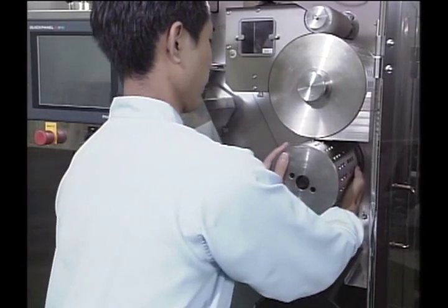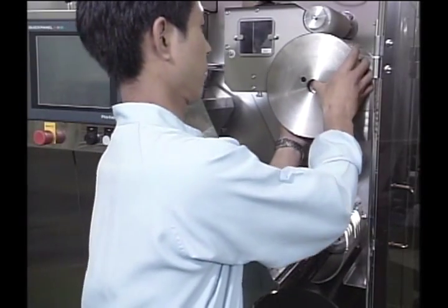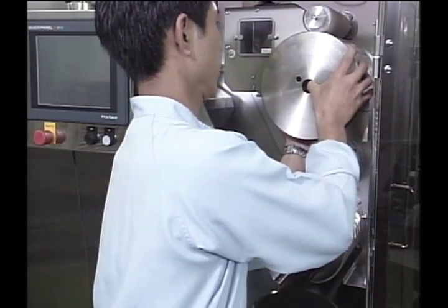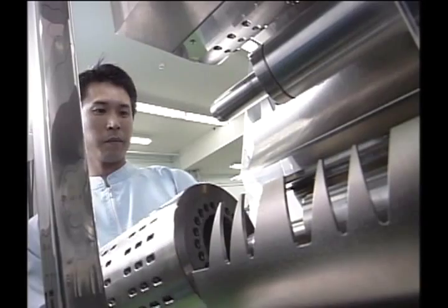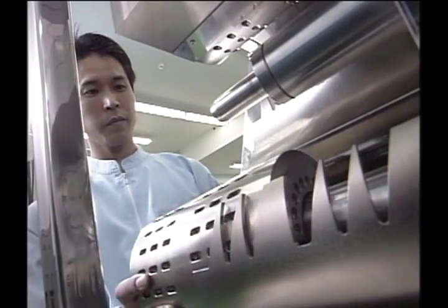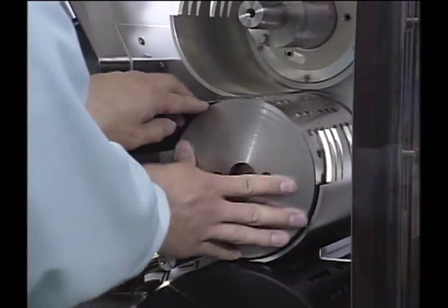The unit that controls the rectification or transportation can be detached without doing anything to the light or camera that have the main role in the inspection. It is also superior for cleaning validation, and the assembly status can be determined by just pressing one button.